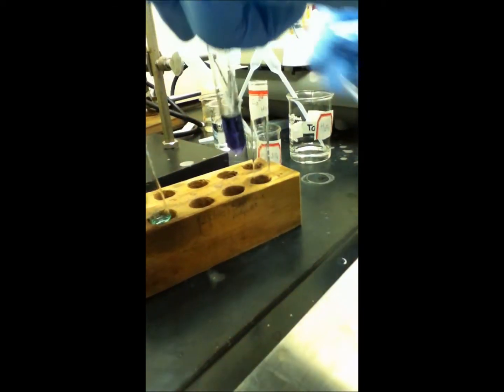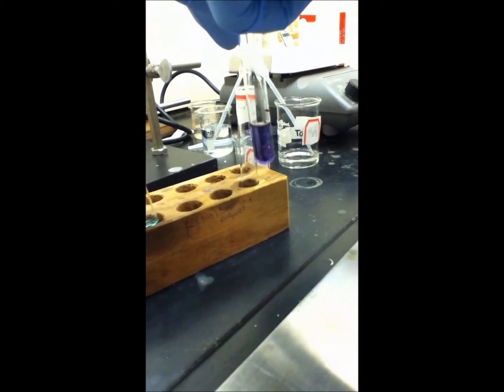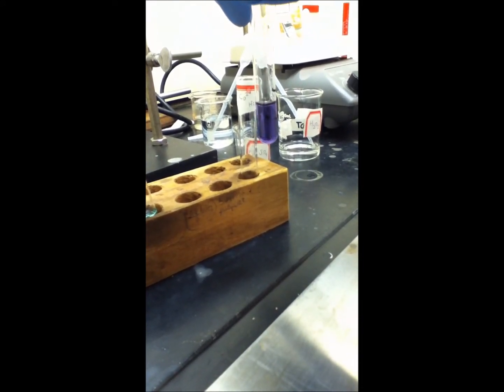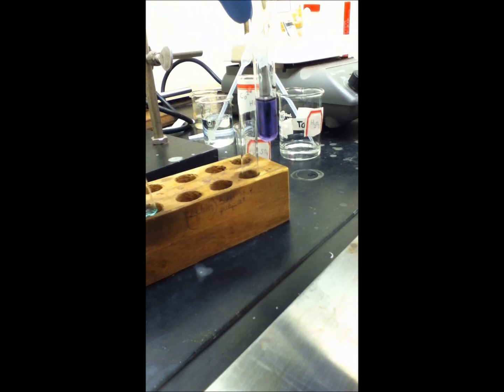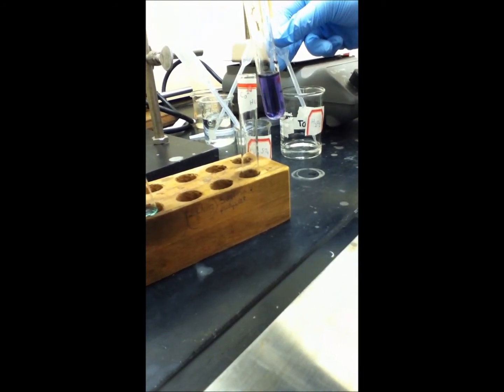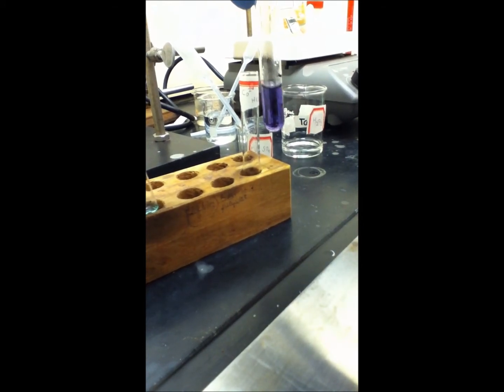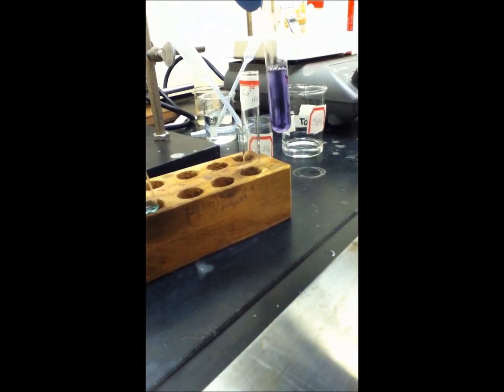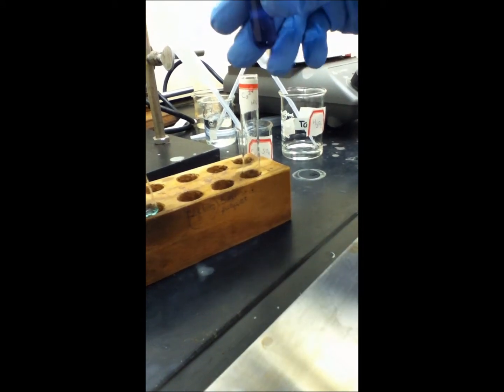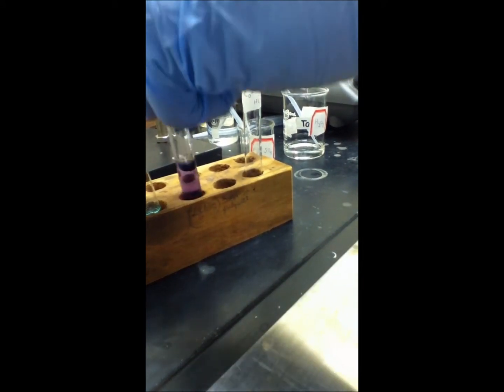Next we have a chromium solution. We're going to add five drops of sulfuric acid, and then add one milliliter of 30% hydrogen peroxide. No changes occurred.